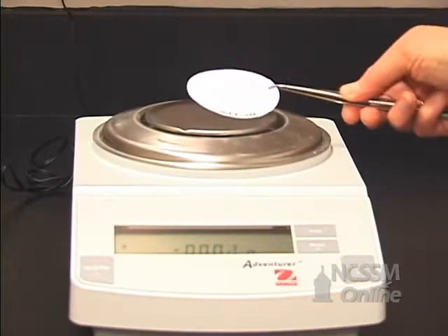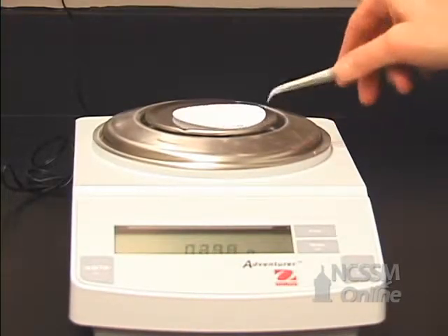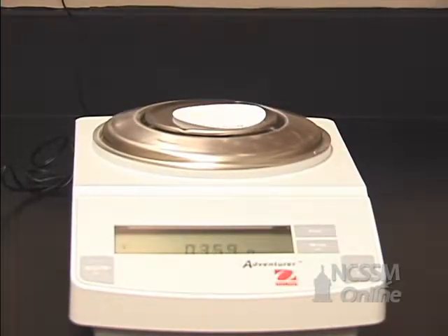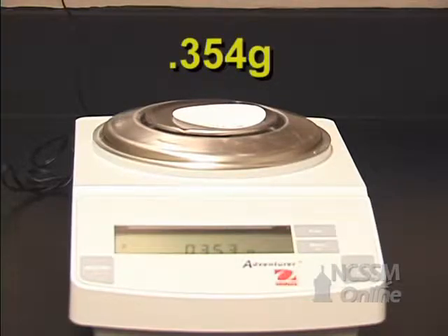We're going to weigh a filter paper. Alright, the filter paper weighs 0.354 grams. So make sure you record that number.